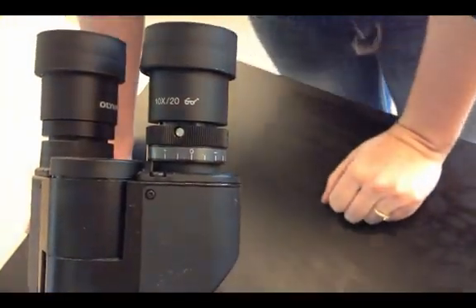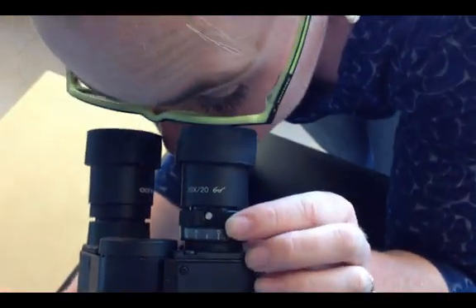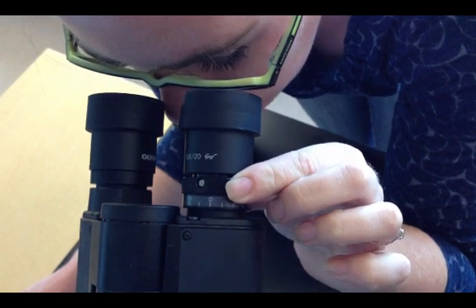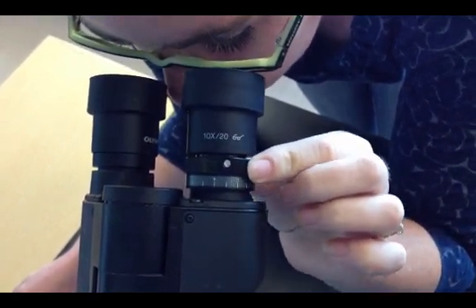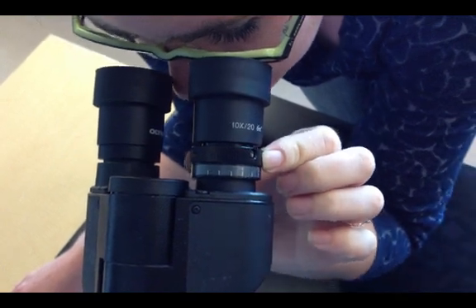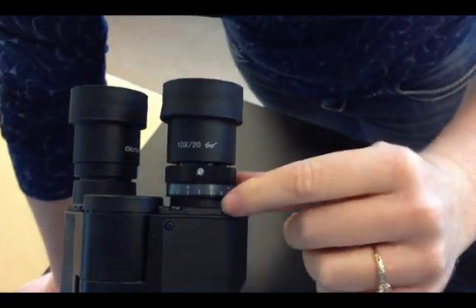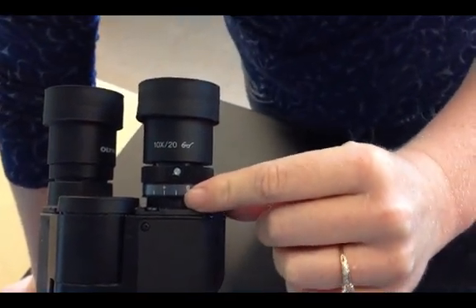Then, looking through only your left eye, look at the microscope picture and slowly adjust the focus on the optical eyepiece. When it looks correct, then you can come back and notice I am about one hashtag above zero.